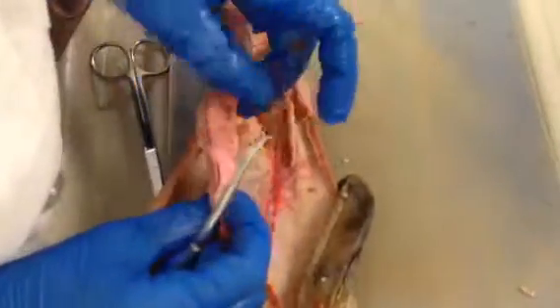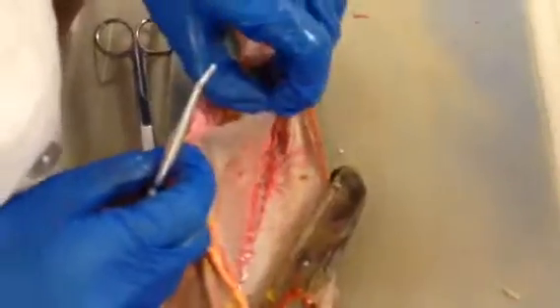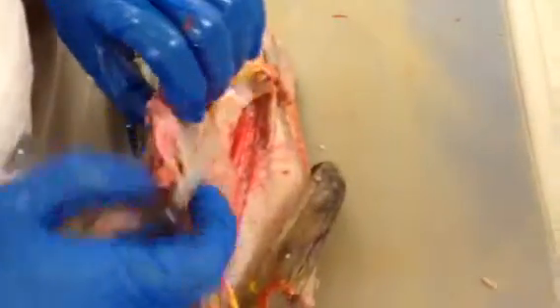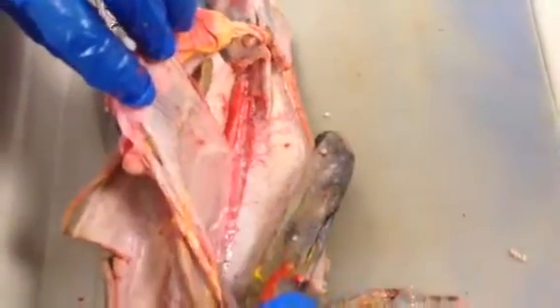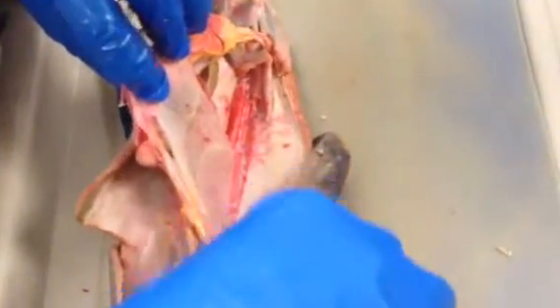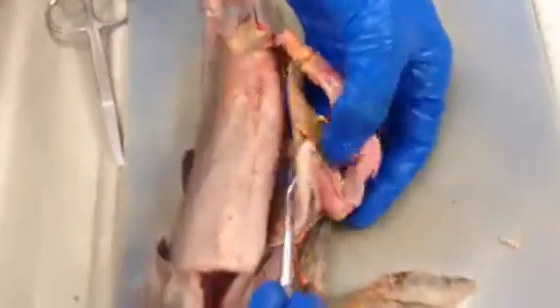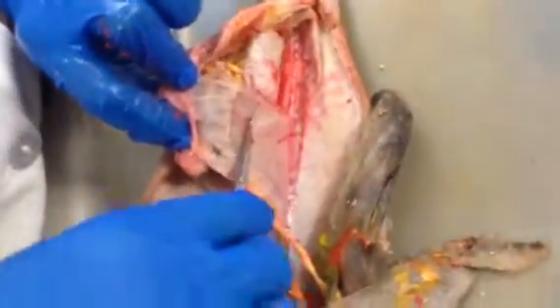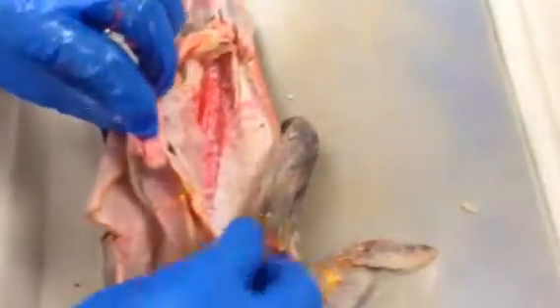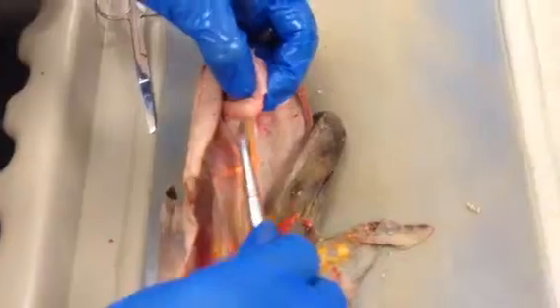Okay? Now the mesentery attaching the valvular intestine right here is called the mesentery proper. You can actually see a line right here. That's where it attaches to the greater omentum from this side. So you have greater omentum, remember, attaching to the stomach. Then when we pull up the valvular intestine, you can see mesentery proper here. And then don't forget, this part and its two sheets are called lesser omentum, with the gastrohepatic portion and the hepatoduodenal portion.